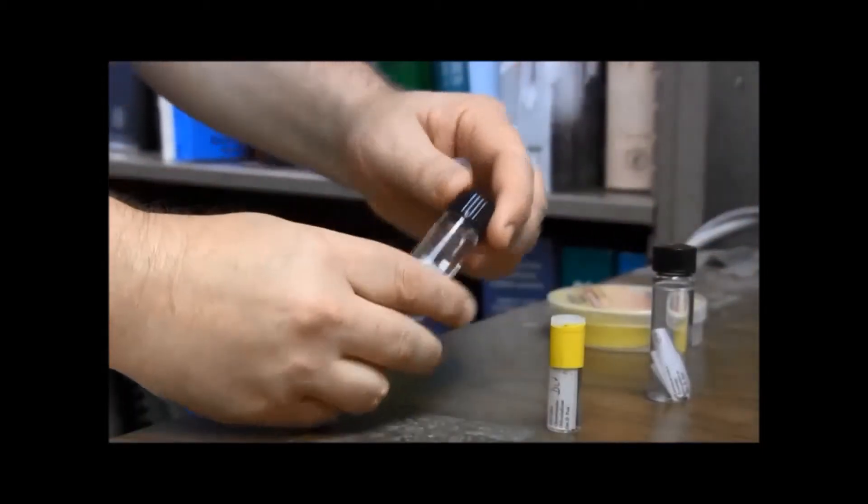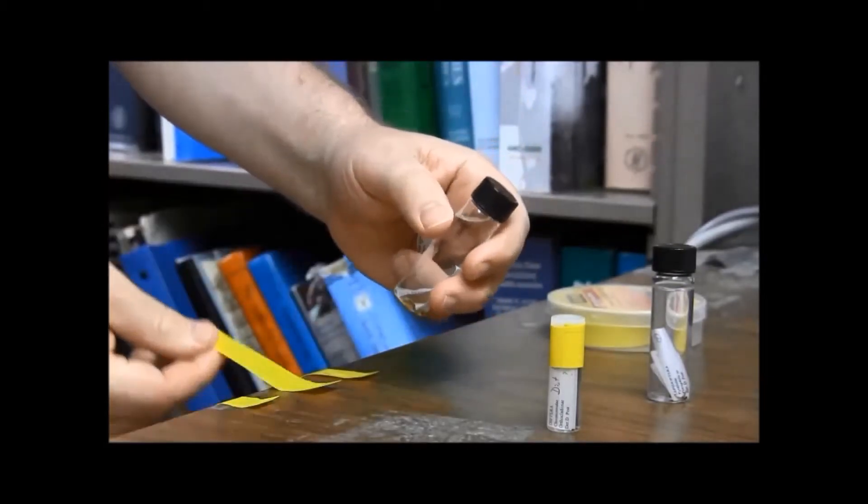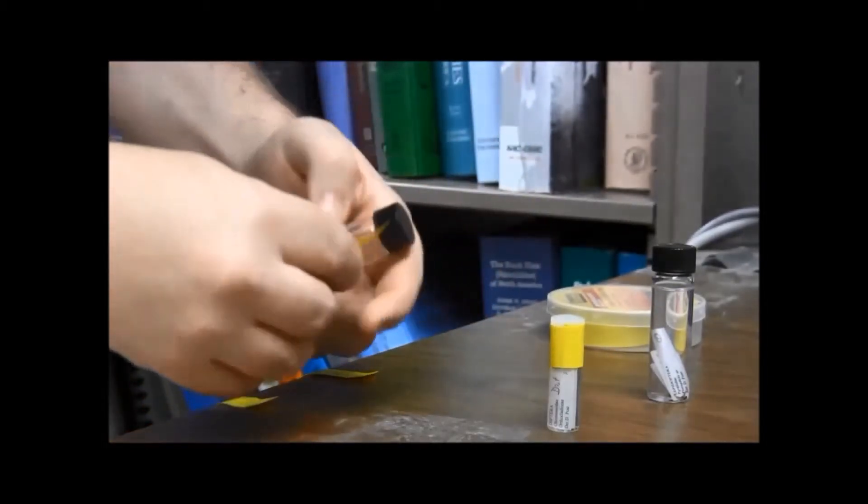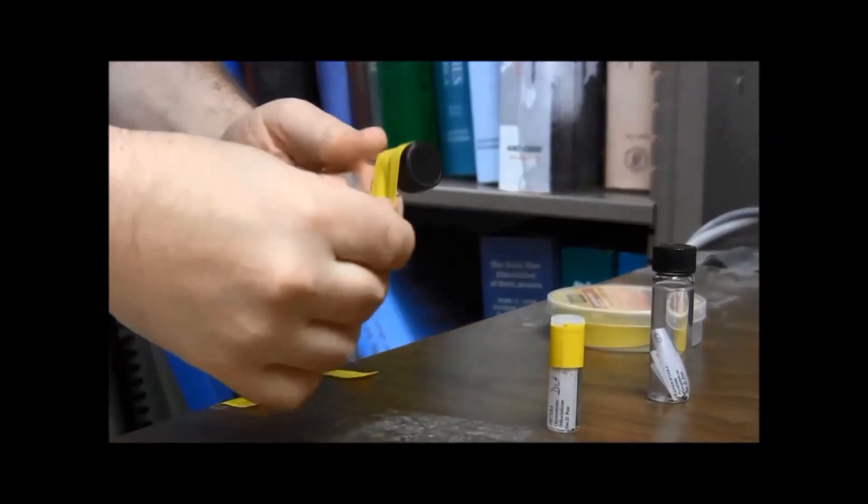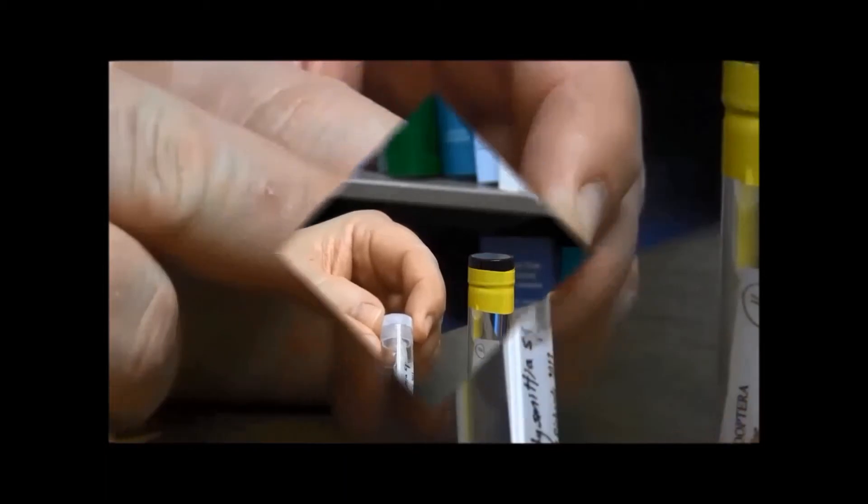Even if you have a screw-cap vial, it doesn't hurt to secure those as well. See this air bubble here?